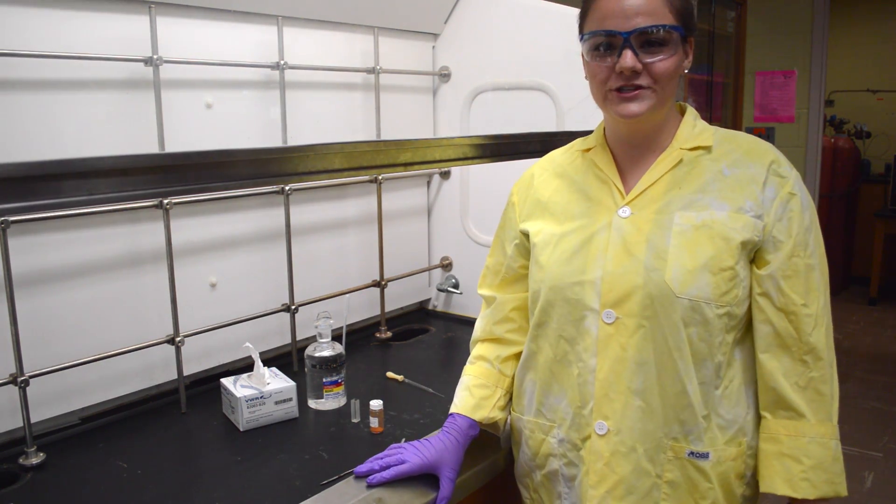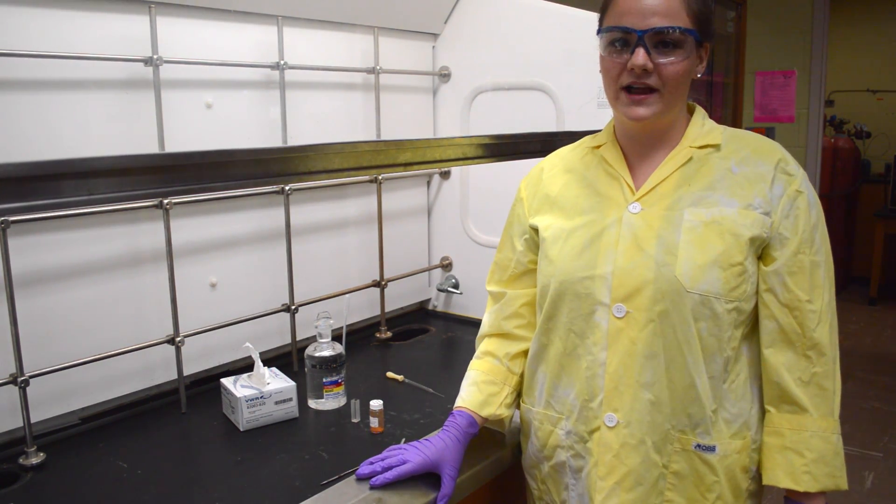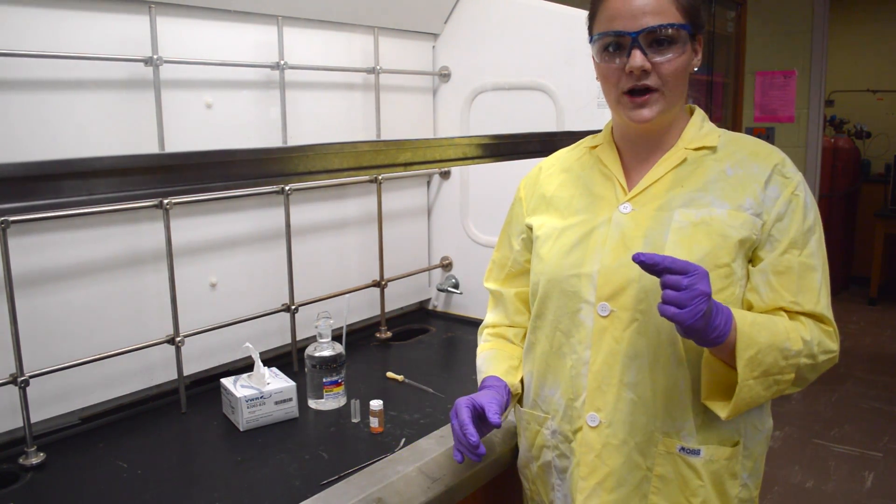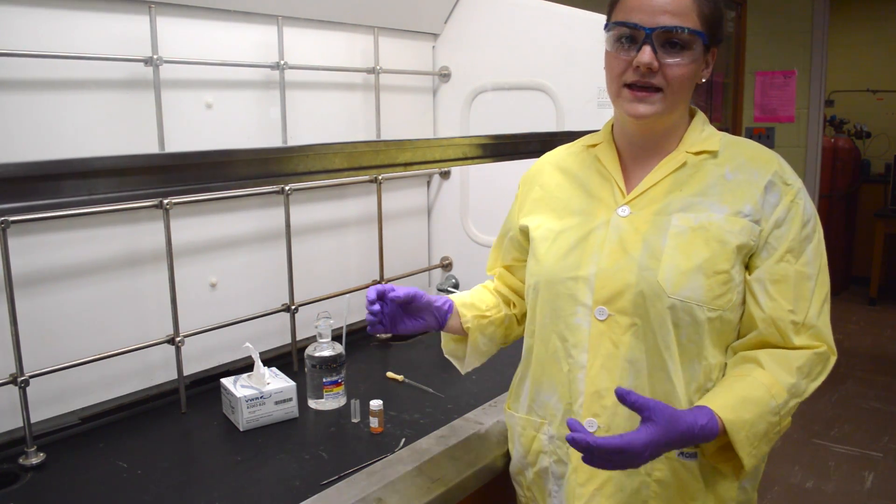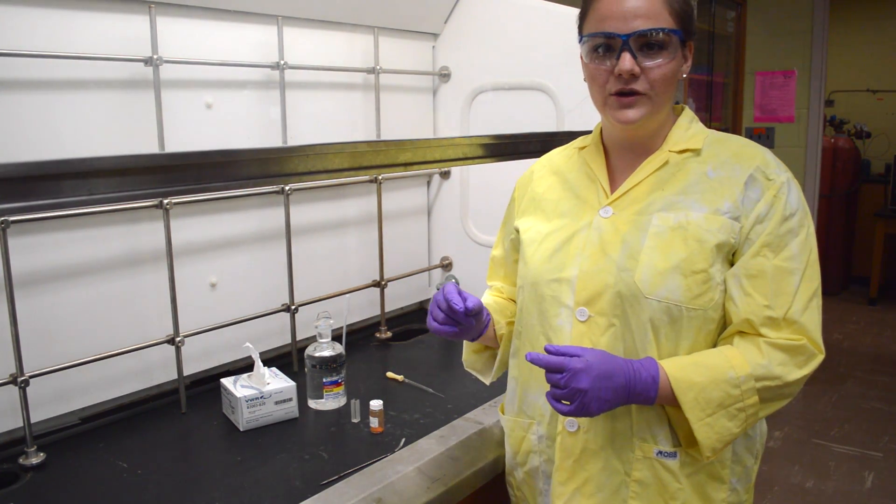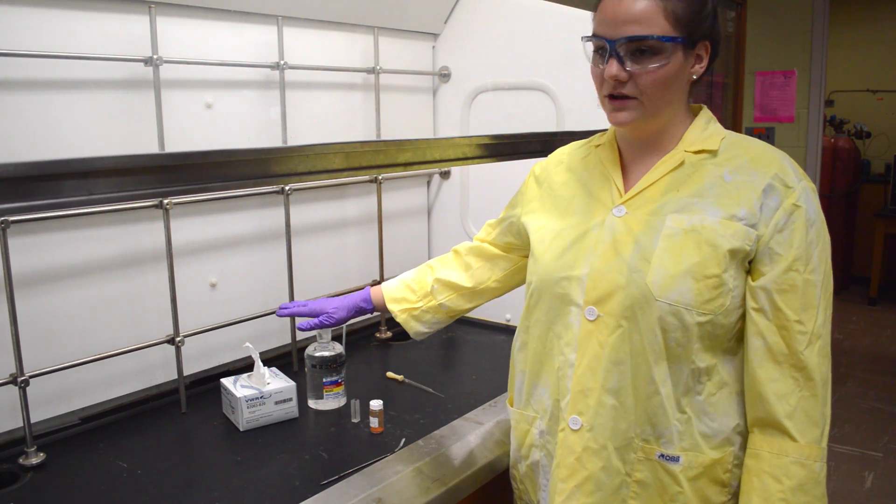To prepare a sample solution, any liquid or aqueous solutions, you just add one drop of the desired product and then you would fill the rest of the cuvette with the solvent used.